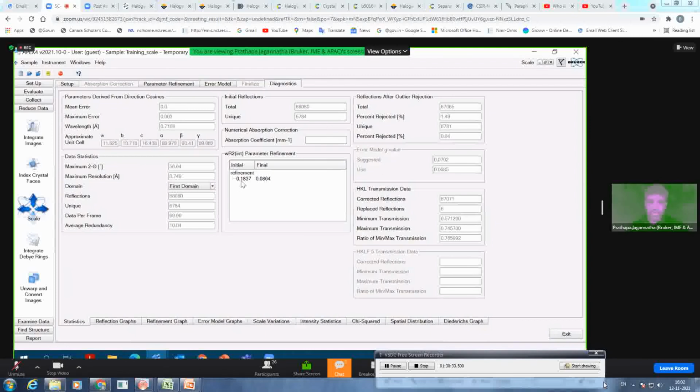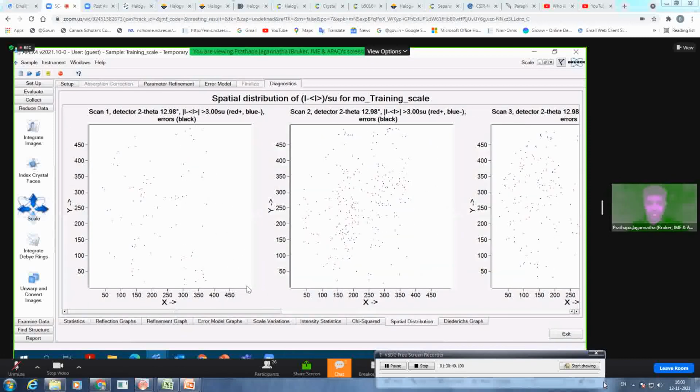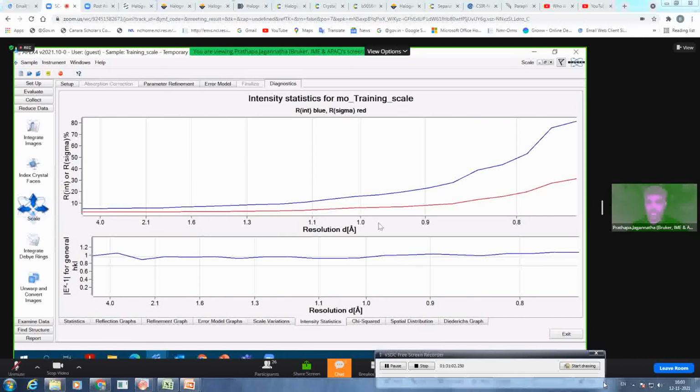You can see we started with 18%, it came to 8%, which is quite good, and rejected reflections are around 6, only a few, but it is quite helpful. And the Diederichs graph, okay, it's weaker, but it is still in a good direction. If you look at the spatial distribution, of course there are some reflections which are overestimated or underestimated, but that's reasonably okay, not too many reflections. If I look at chi-square, it's close to 1. Intensity statistics up to 0.9 or 0.8 are quite good, and after that it is on the higher side. And then the E squared minus 1 statistics tell us it is centrosymmetric.